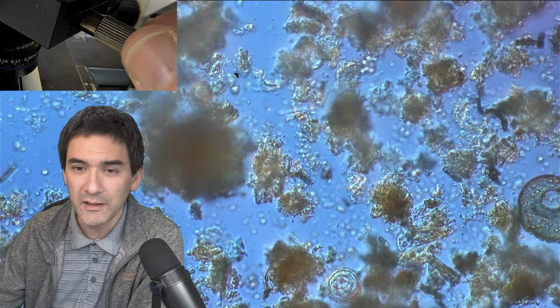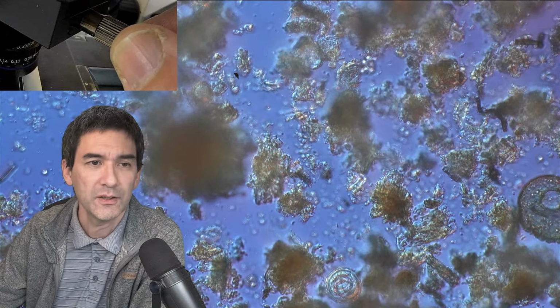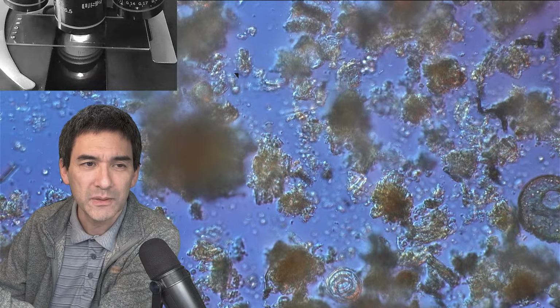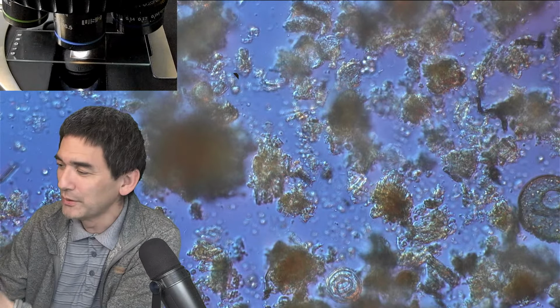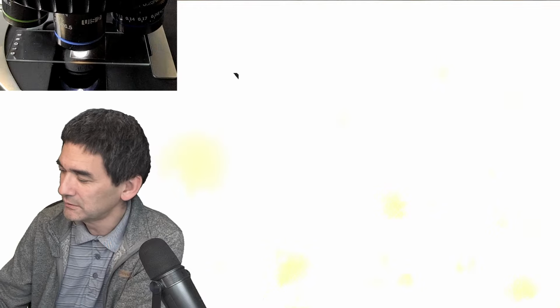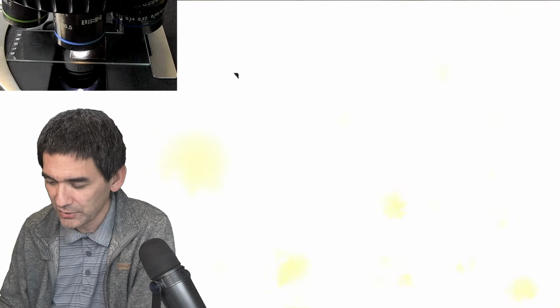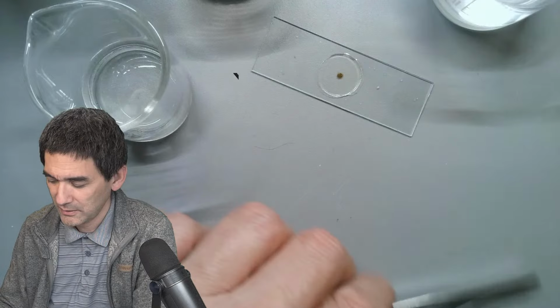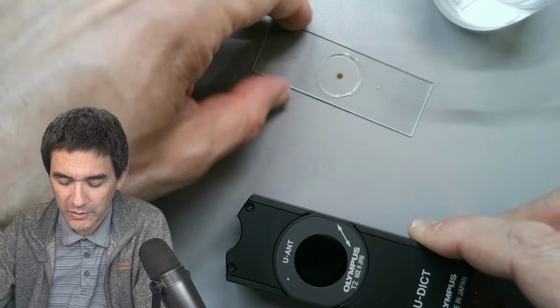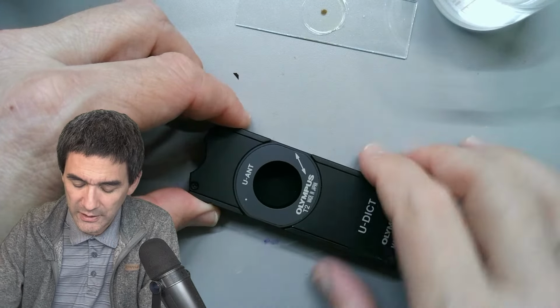Because you were asking, I'm going to take this out so that you can have a look at what's in there. Okay, so I'm going to put it back again here. The camera. I used some double-sided tape to glue the camera directly onto the microscope. So I'm going to show you. I'm pulling it out now. Okay. I need to turn on the desk view again, just to show you how this looks. It might be dangerous with all of the water, everything. This is how it looks, and it's a little bit dusty already, right?